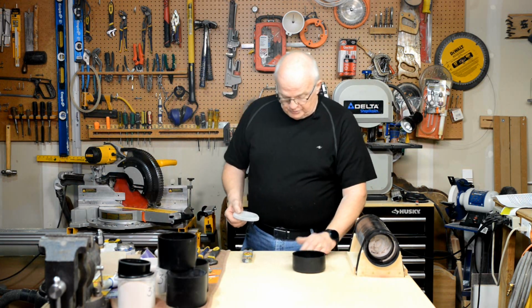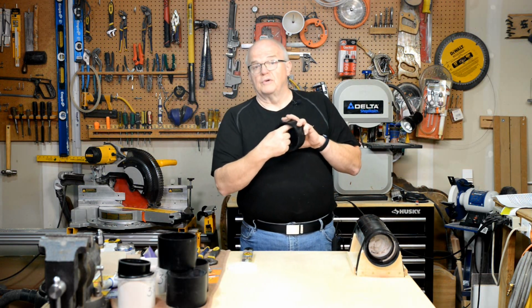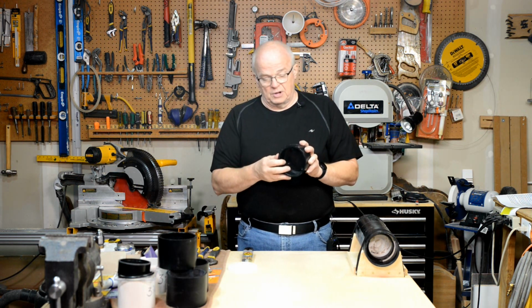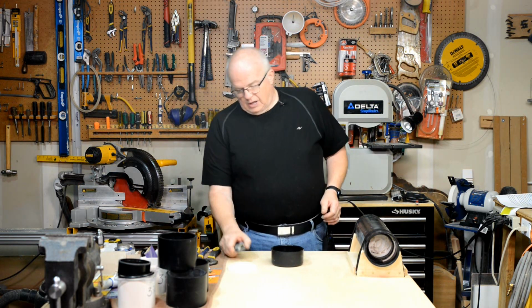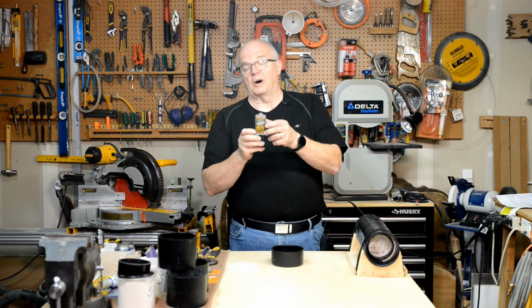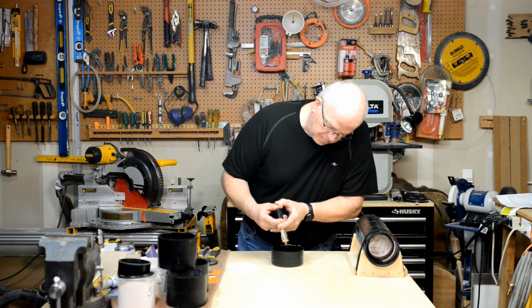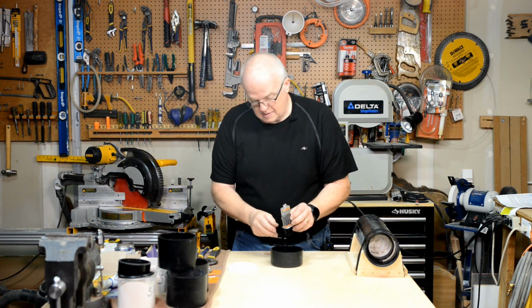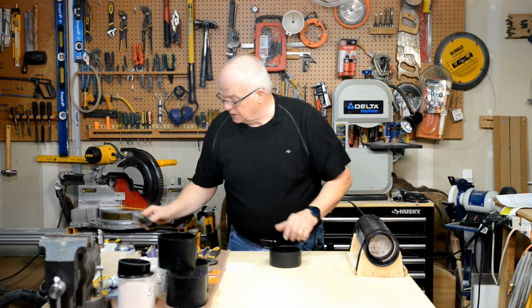Second thing I want you to do is to remember to take this cap, and I assume that you've already pulled out those injection nibs that are in there, the 4 along the outside edge and that one in the middle, and cleaned it out, make sure there's no oil or anything like that or no dust. Then take this 2-part epoxy. You're going to want to squeeze about half of that into this cap. Okay, there's about half of it. You can wipe that off onto there.